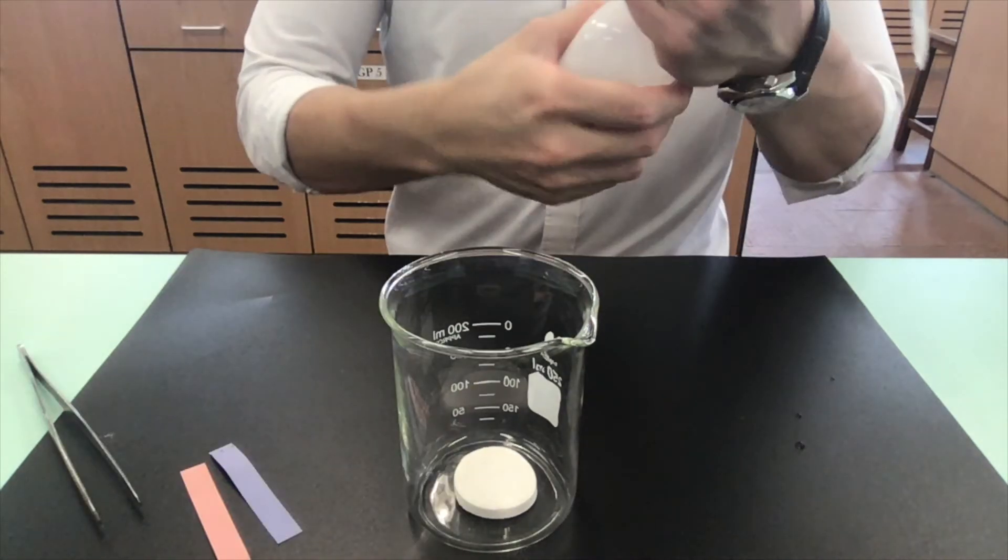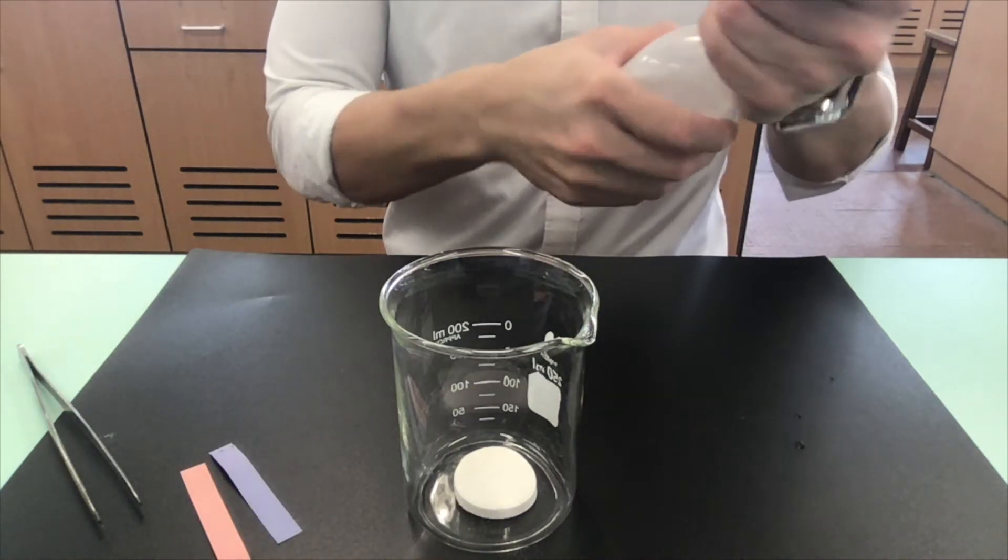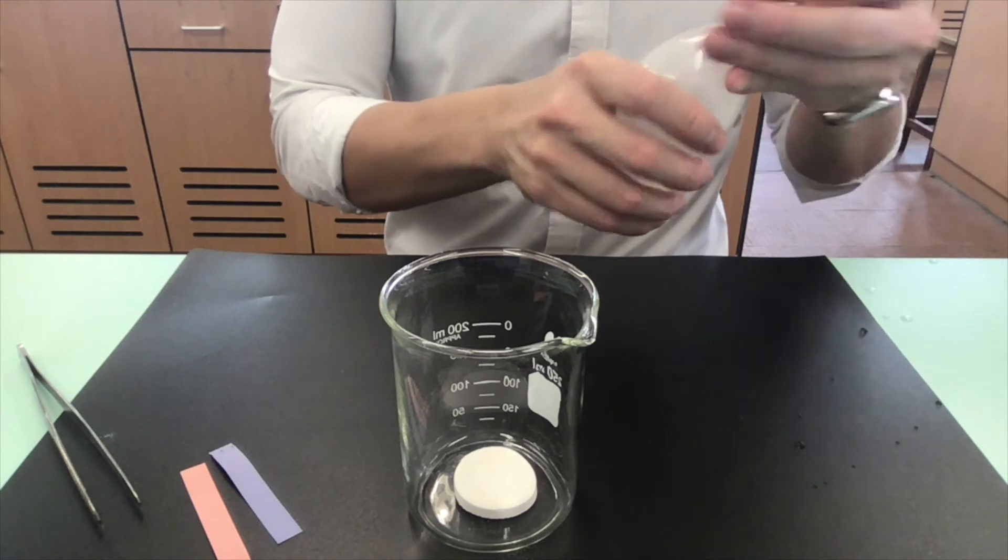When there is no water, it is obvious that the vitamin C and the carbonates are not going to react.